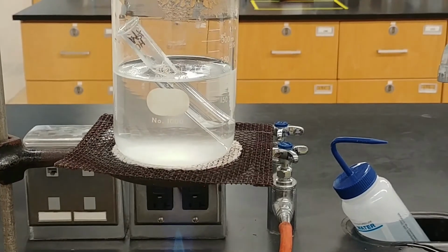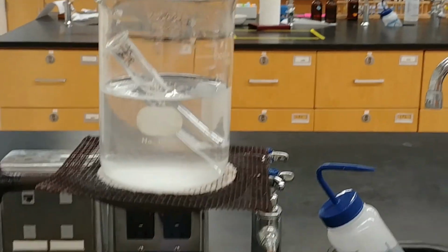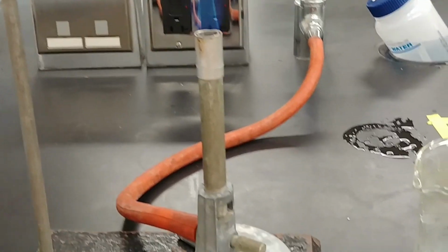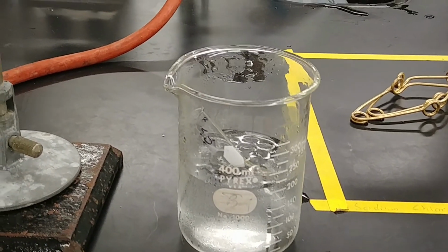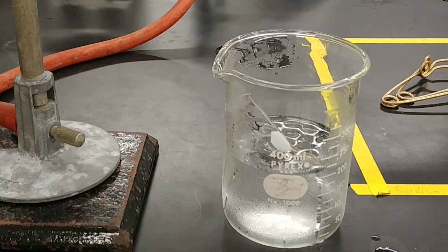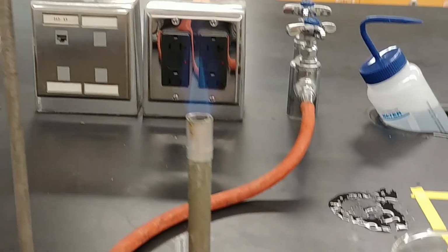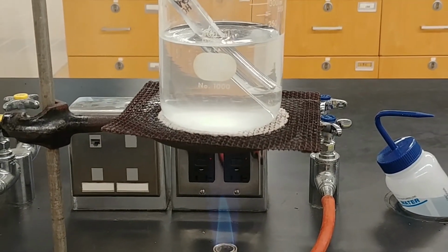Next leg of our experiment has us comparing hot and cold. So we are creating a hot bath and heating up a little bit of the hydrochloric acid, 1 molar. And we have a cold bath here for another sample of 1 molar HCl. We're gonna let these arrive at very different temperatures, and then we're going to see how that affects the rate at which our magnesium and hydrochloric acid react.